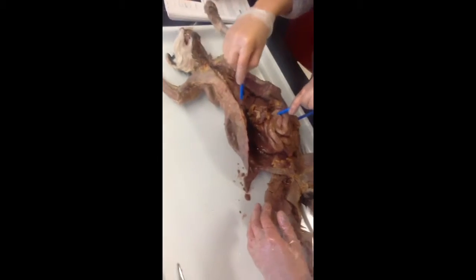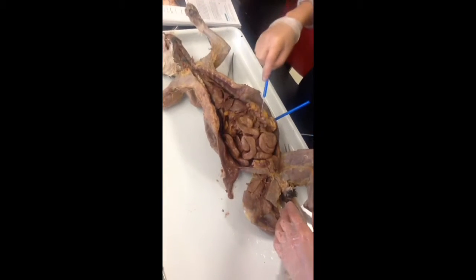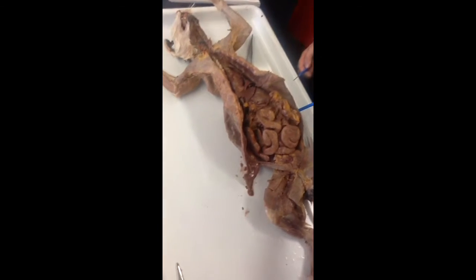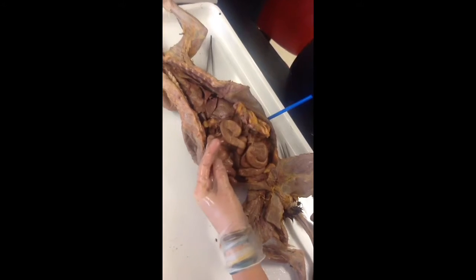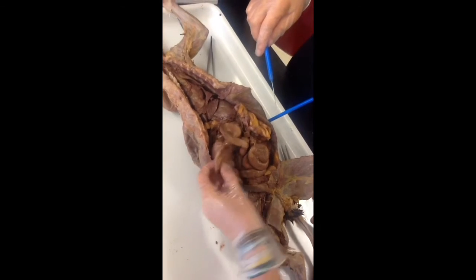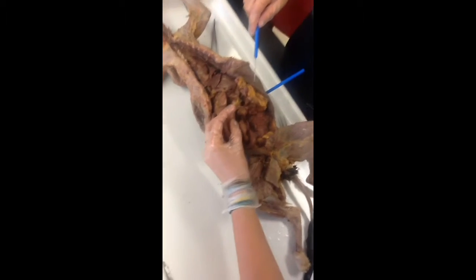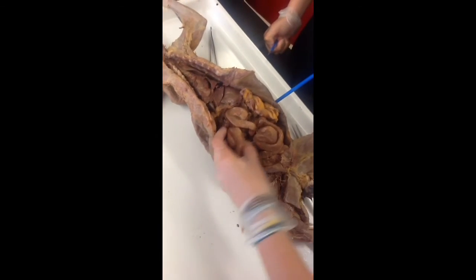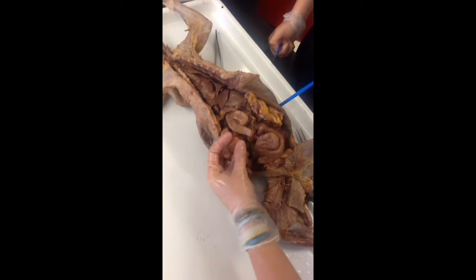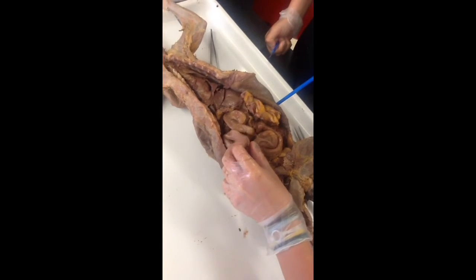So this is still the liver, right? So then what's the mesentery? It looks like stuff in between the small intestine. Isn't it like the ileum? It connects it. Yeah, the mesentery is going to be all this layer. See how it's all throughout the small intestine? It's just anything of this really thin connective layer. So I would pin it, and anything pinned here would be the mesentery.